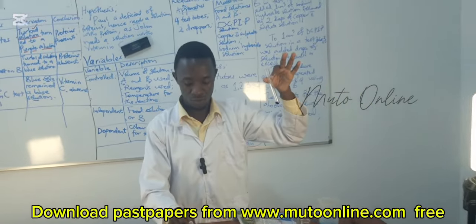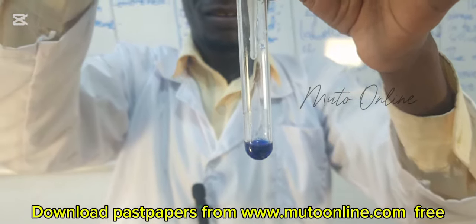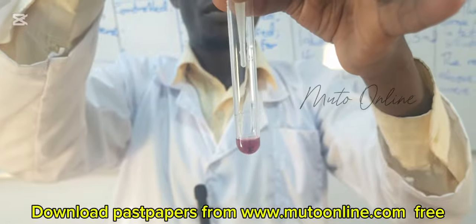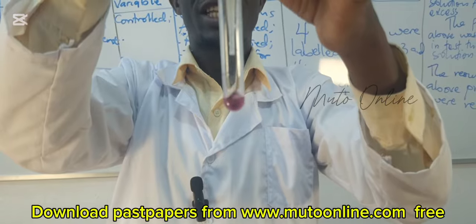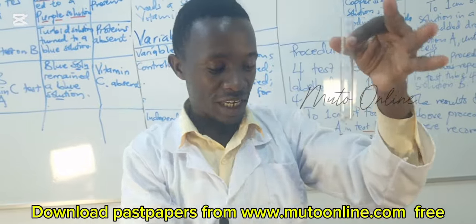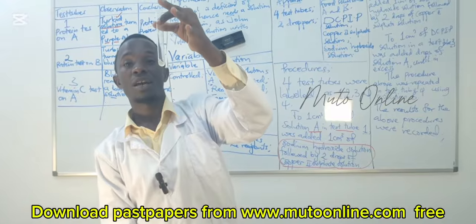So this is our solution B. There are some experiments where we need to compare the amount of vitamin C in each solution. There we shall be counting the number of drops and recording. And it is evident that solution B contains vitamin C.